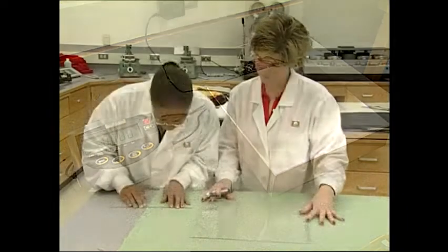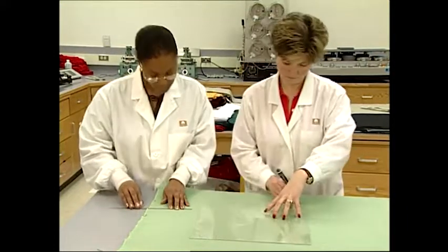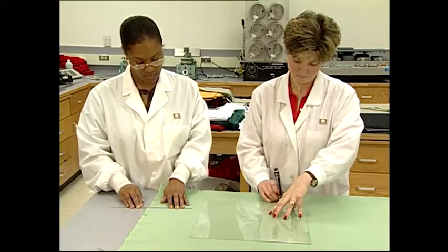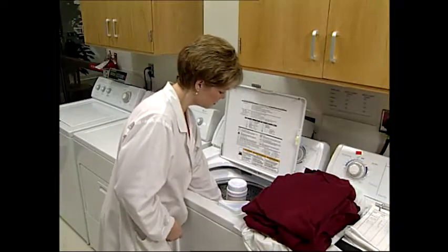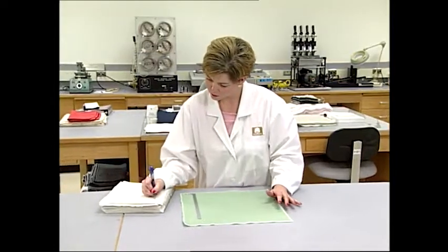The procedure for measuring dimensional changes has four steps. These include a preparation step, a testing sequence, an evaluation process, and a data recording process.